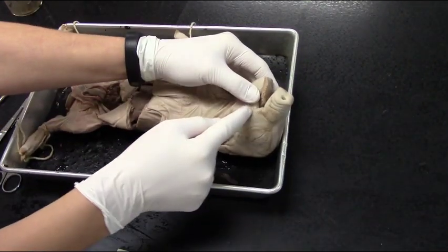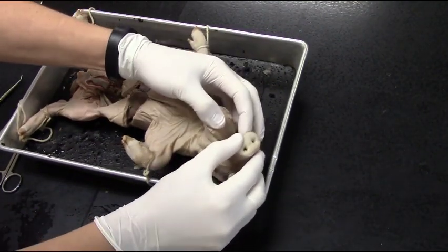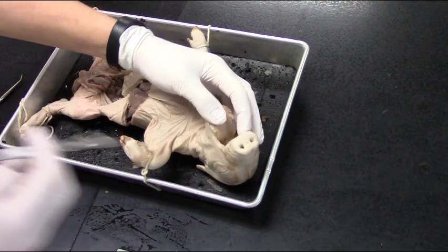Our job today is going to be to make incisions along either side of the mouth to be able to look at the pharynx, which is the region in the back of the mouth.